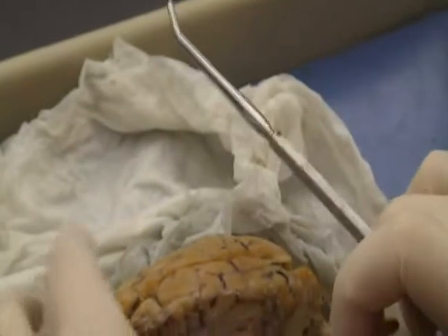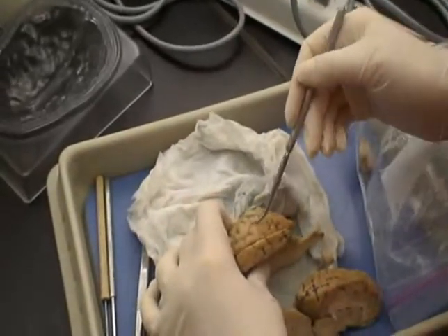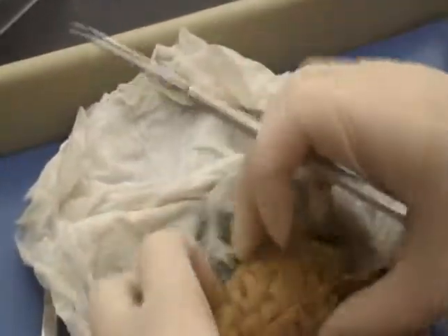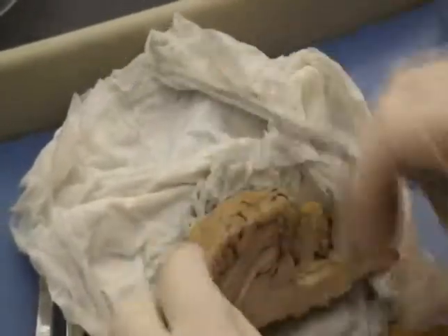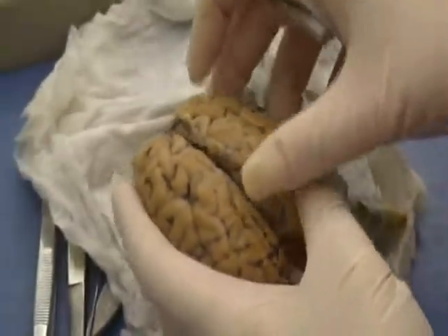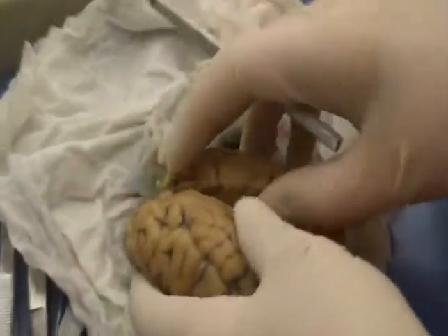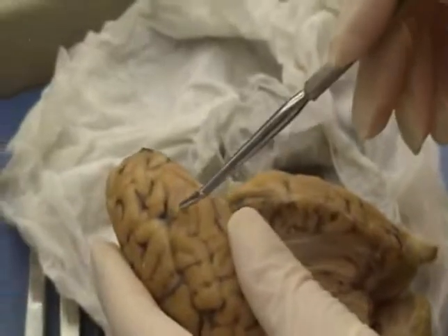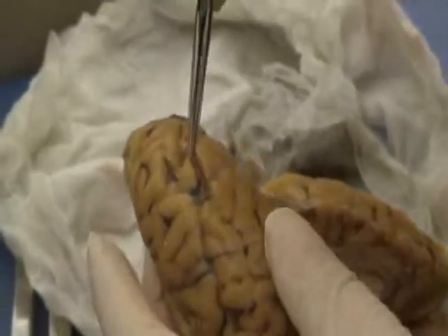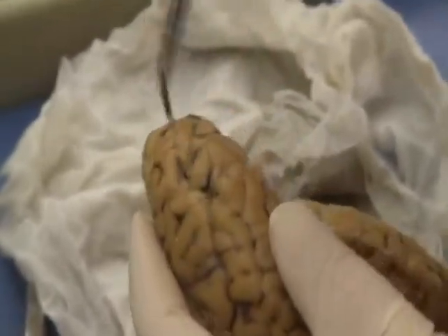The meninges, we're missing them, but the dura mater's on the outside, the arachnoid's underneath that, and then the pia is attached to the brain. Here, the cerebrum, the upper top portion of the brain. The longitudinal fissure is the big groove down the sagittal plane. The cerebral hemispheres, one half, second half. Gyri is an upfold, that's plural. Gyrus is one upfold. The downfolds, the grooves between the gyri, those are sulci or a sulcus.